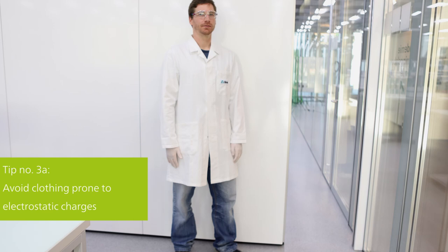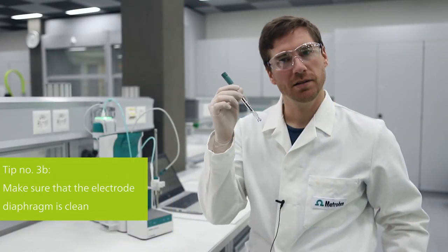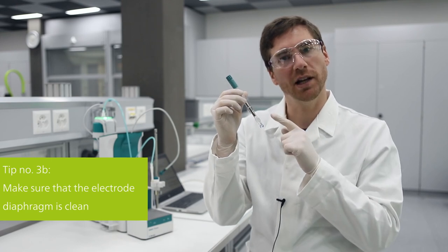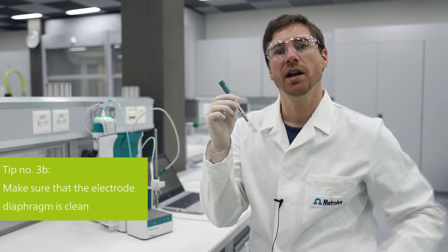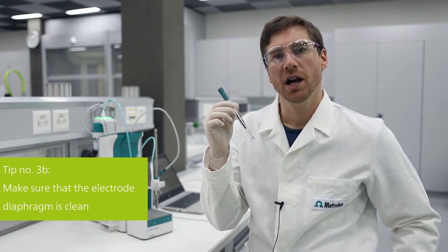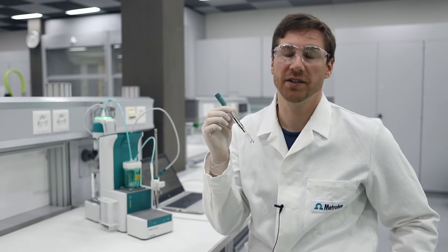Second, make sure the diaphragm of your electrode is not blocked. In the first part of my tutorial, I showed you how you can avoid a blocked diaphragm by cleaning it. So watch the first part of my tutorial to see how this is done.